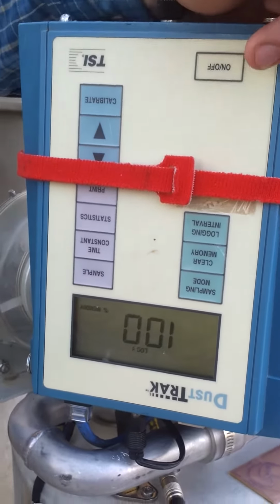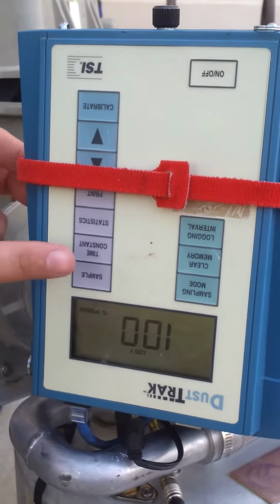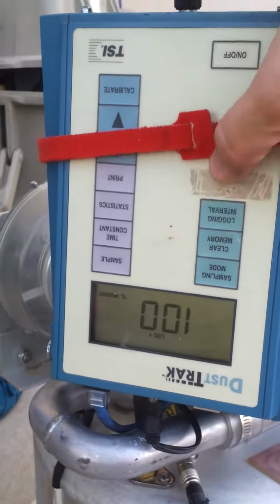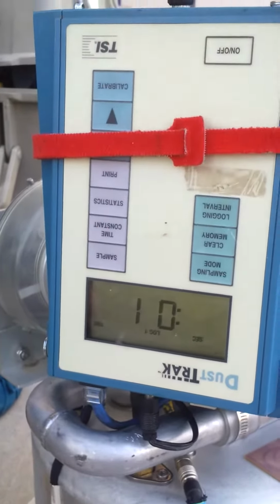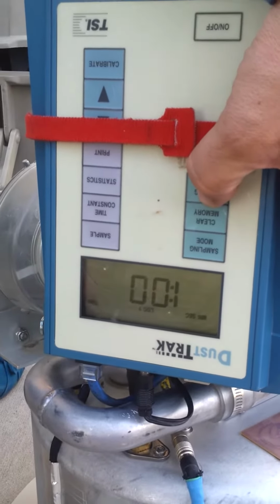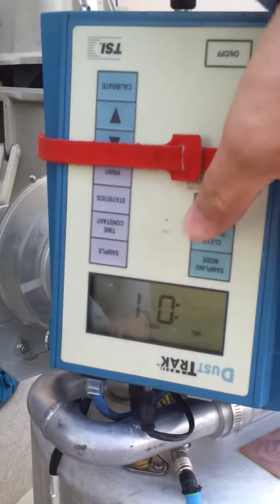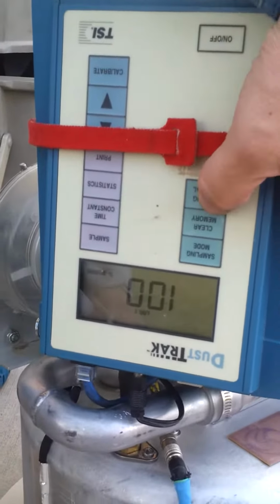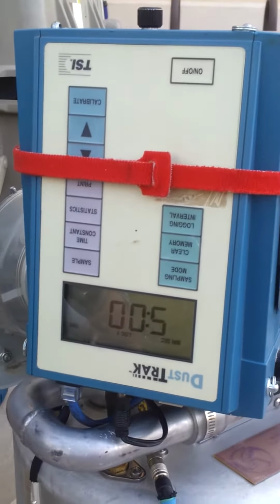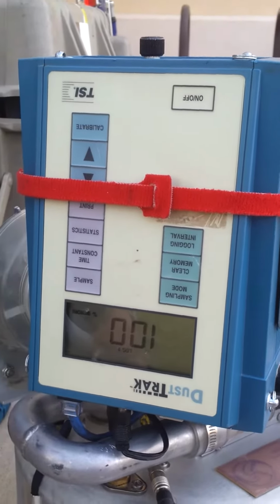But that's a good point. So don't confuse the logging interval with the time constant. So time constant is a running average. You keep that at 1 second. And the logging interval is if you were to go into the sampling mode and log the data, then depending on which logging mode you leave it in, it would log the data in what we have here. That doesn't matter for the Pi Swirl, right? Right, doesn't matter. Yeah, exactly. The only thing that matters is the time constant button. Right, exactly.